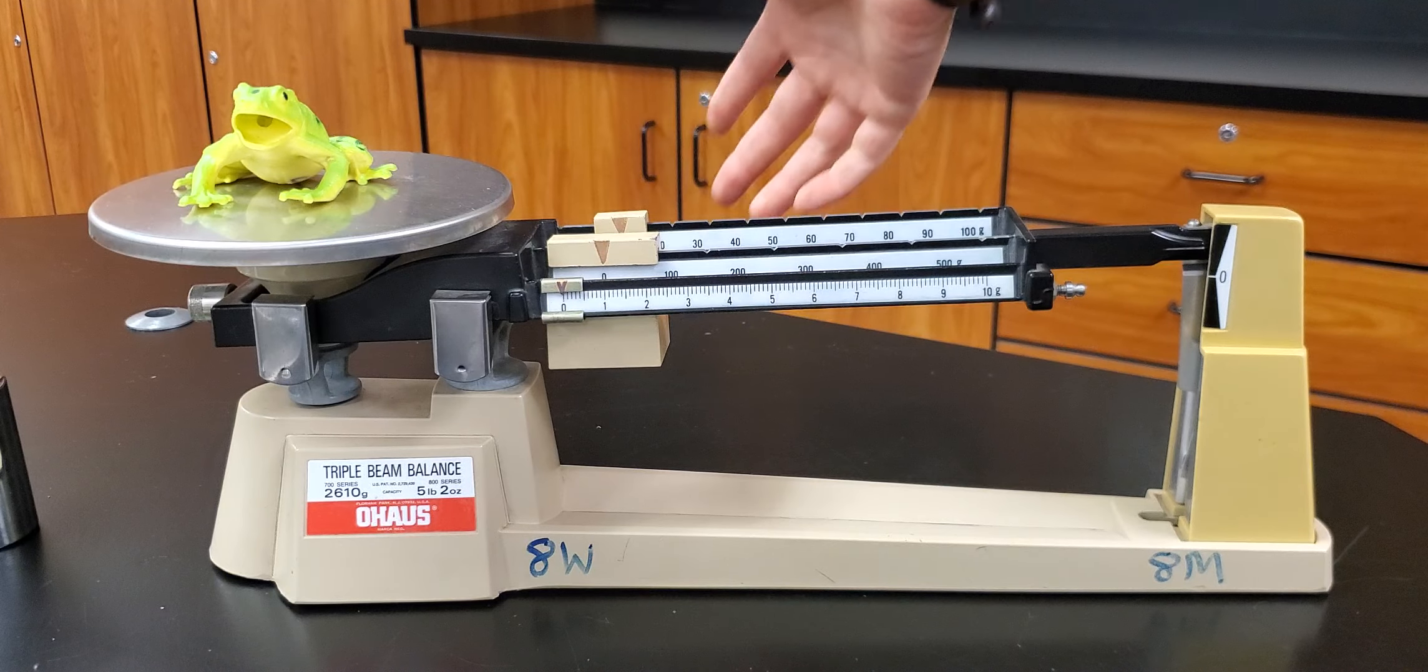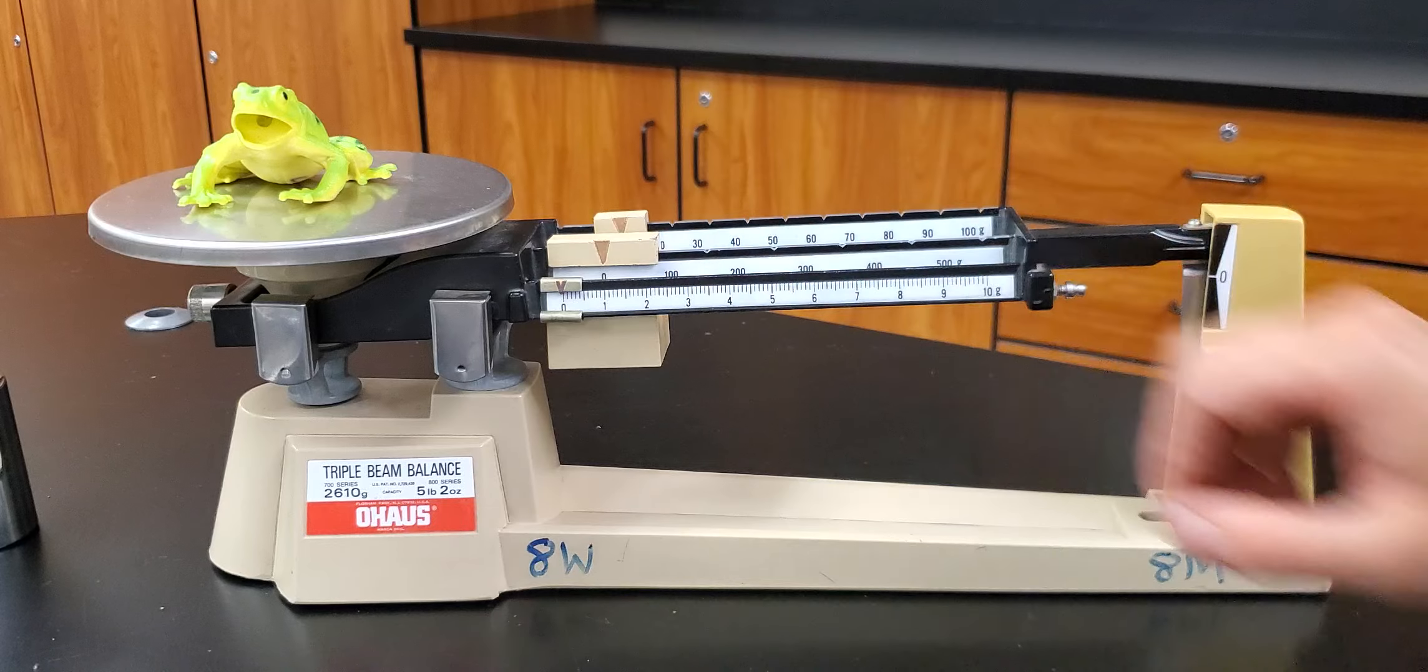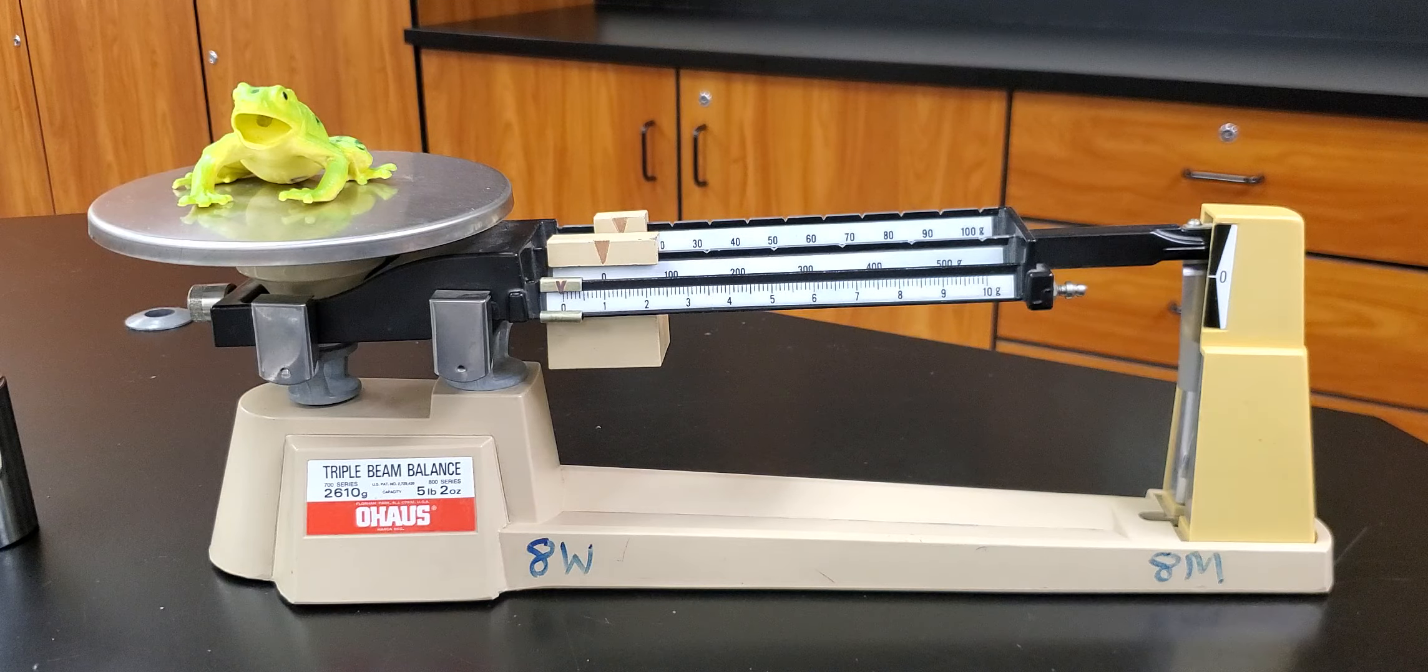and then finally your smallest weight down here. If you have any questions let me know. Good luck!